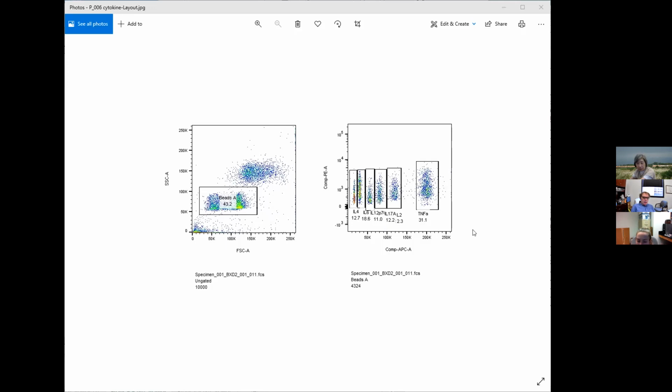This is a good sample, because IL-4 we know is low. And sure enough, I see a cluster of beads down at the bottom with a low value. And the value beneath there, if it's the mean, is low, 12.7. Versus TNF, which we know is high, and its beads are shifted up, and the number is shifted up at 31.